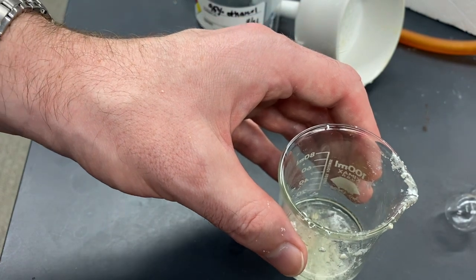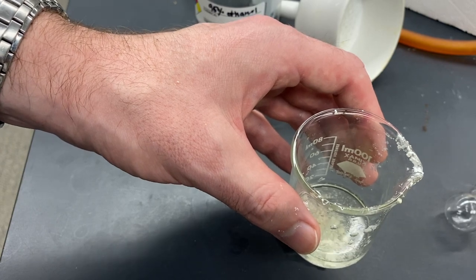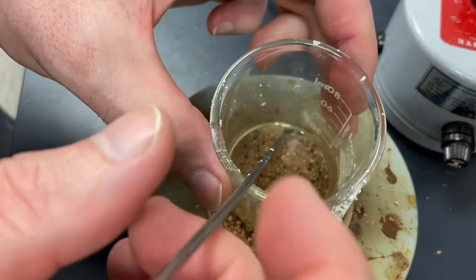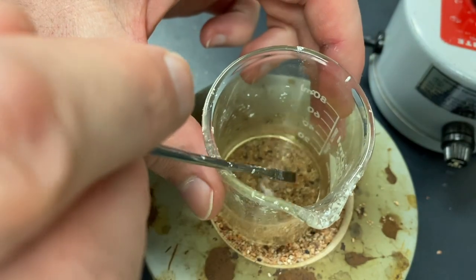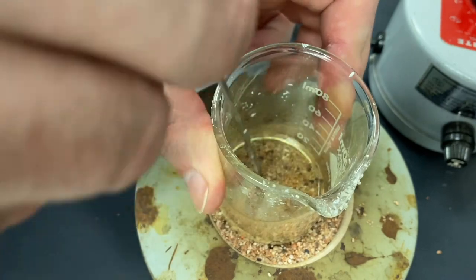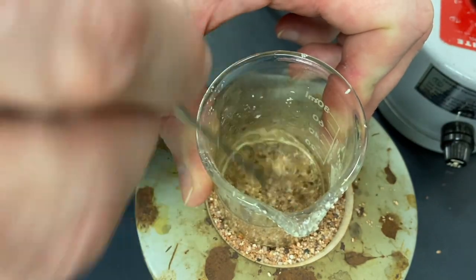Once it does, we've got to let it cool down slowly. So I ended up adding just about 10 milliliters. You might want to go a little bit less than that just in case. And I've almost got everything in here dissolved.